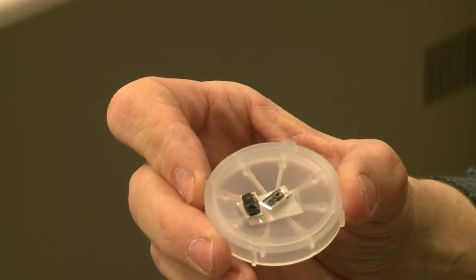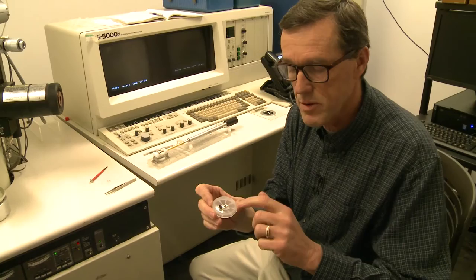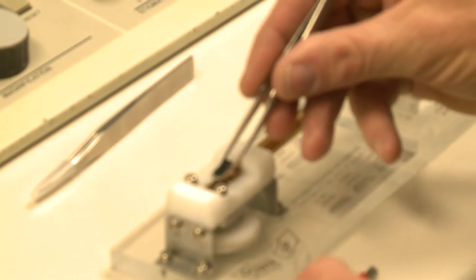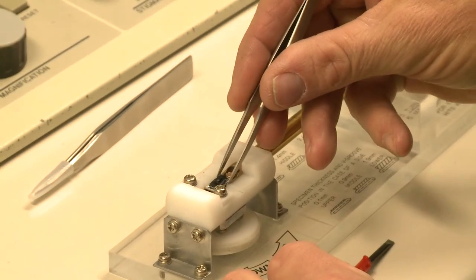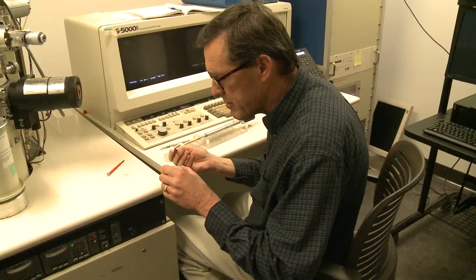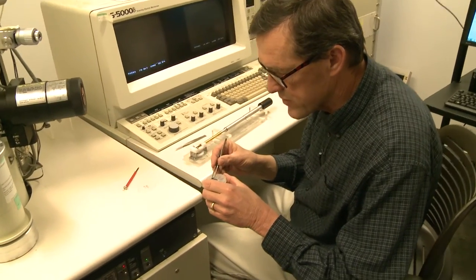The samples are carbon nanotube samples which have been grown on either a gold wire or a silicon wafer. I've got two different samples here, and I'm going to try the gold wire samples first.